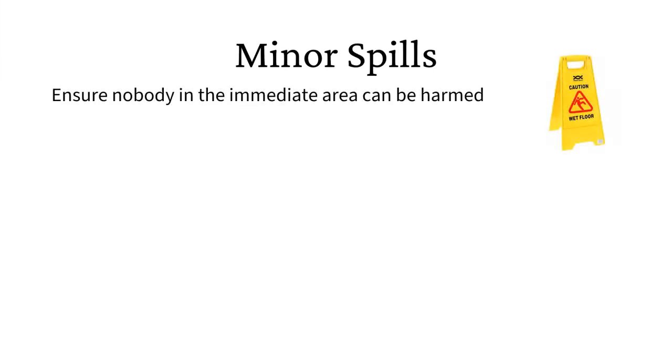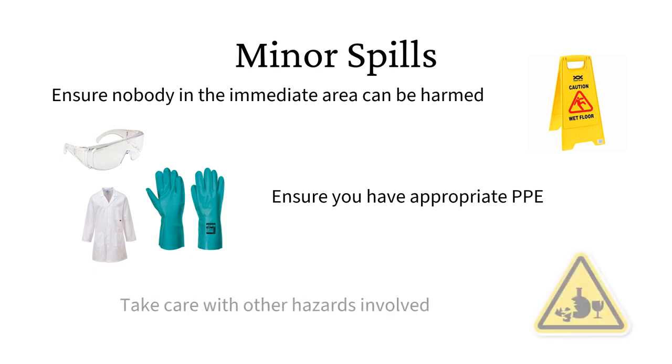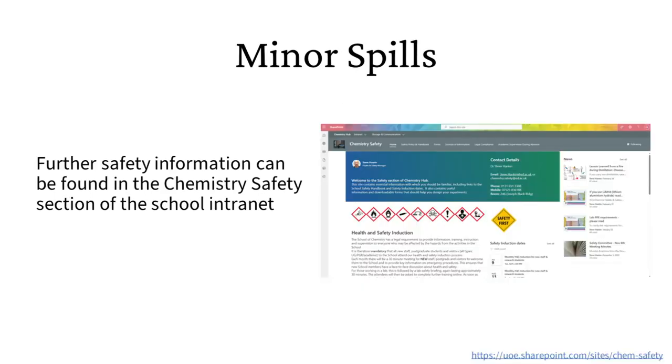In the event of a spill, you should do the following. Ensure nobody in the immediate area can be harmed from the spill. Ensure you have appropriate PPE, including a lab coat, appropriate gloves, and appropriate eye protection. Take care with any broken glass or other hazards involved with the spill. Check what cleanup procedure is needed by looking at the relevant COSH assessments and/or safety datasheet. The school has a general spill procedure which will now be outlined, but you should always seek and follow advice if unsure what to do or the circumstances change.